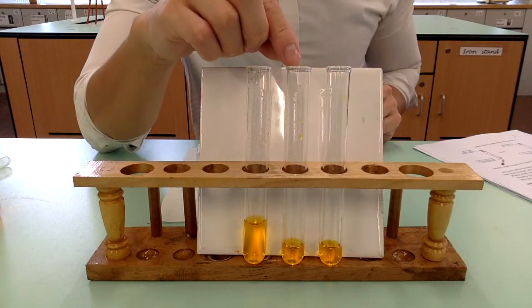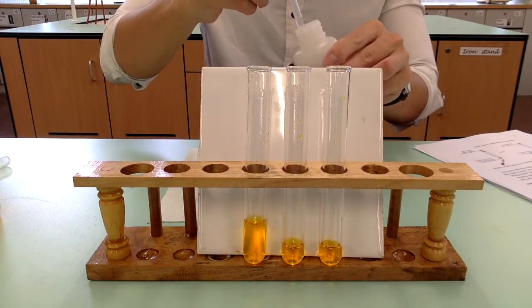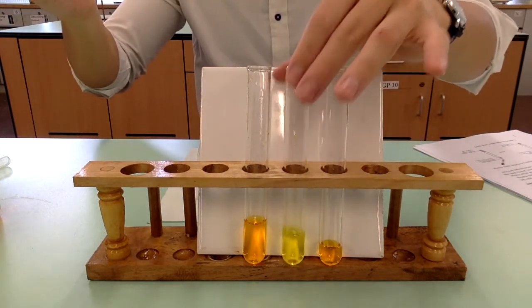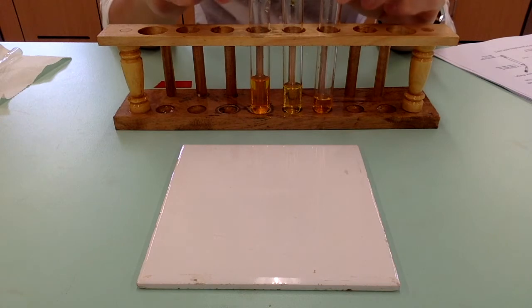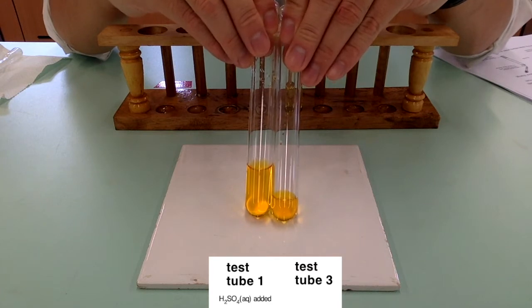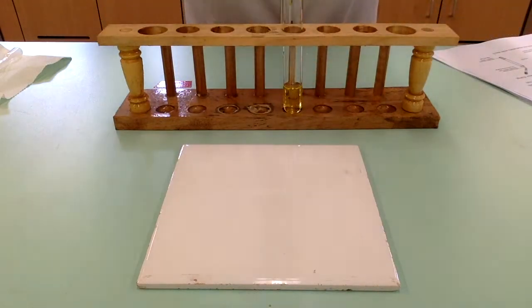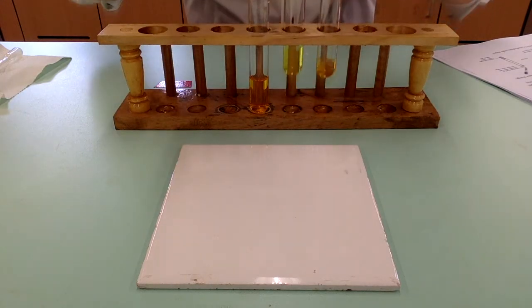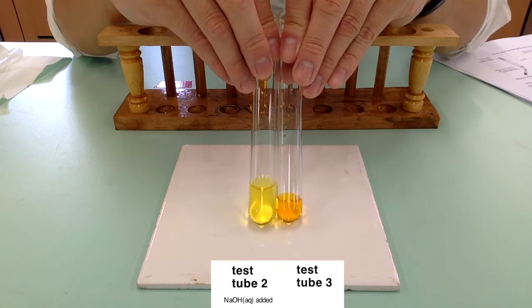To the second test tube, I am going to add dilute sodium hydroxide solution drop by drop. Comparing test tube one and test tube three, the addition of sulfuric acid does not result in any color change. Comparing test tube two and test tube three, the addition of sodium hydroxide changes the reaction mixture from orange to yellow.